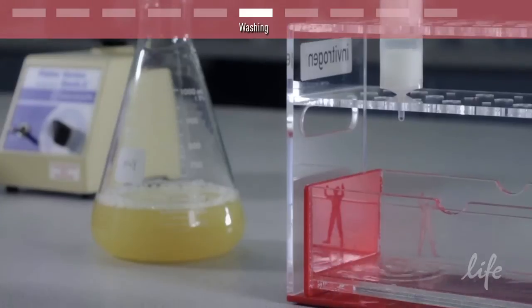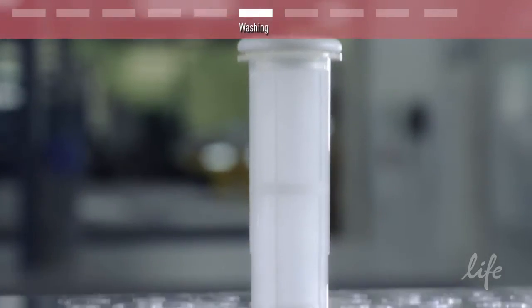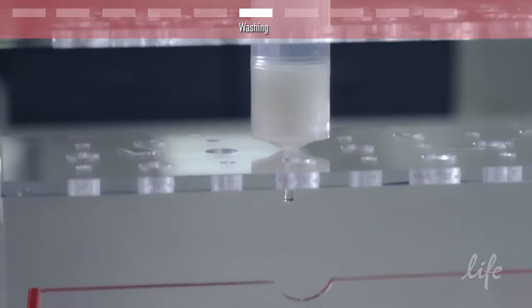Now that the lysate is filtered, it is time for the wash step. Simply wash the column twice with the wash solution provided.